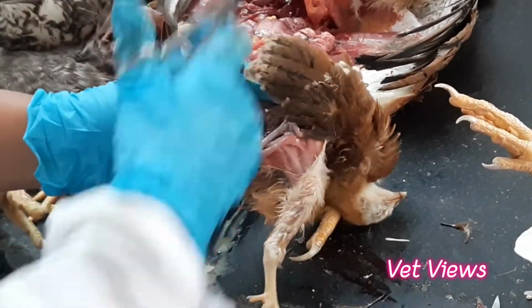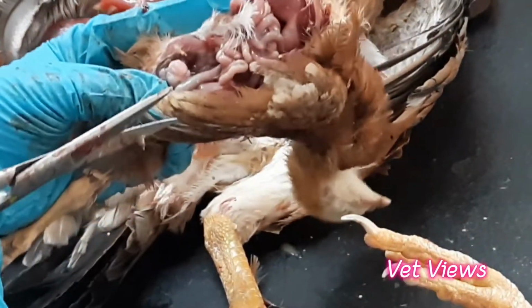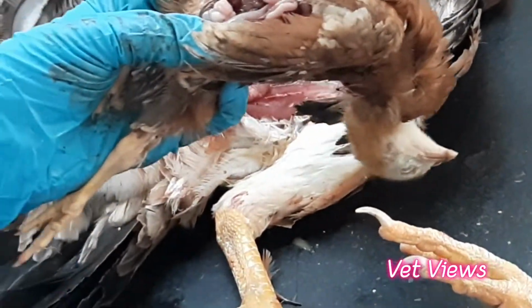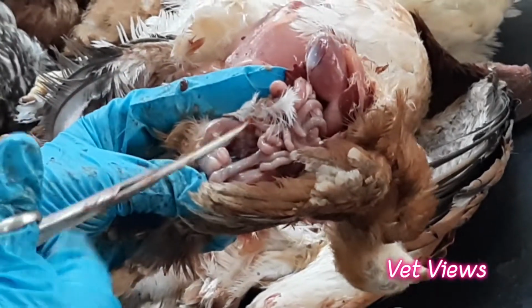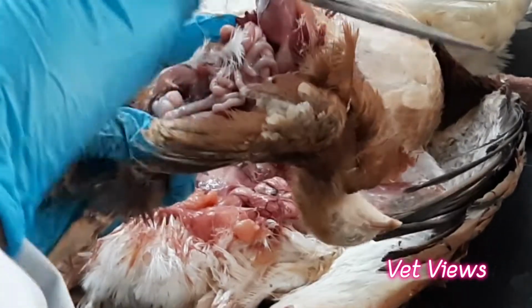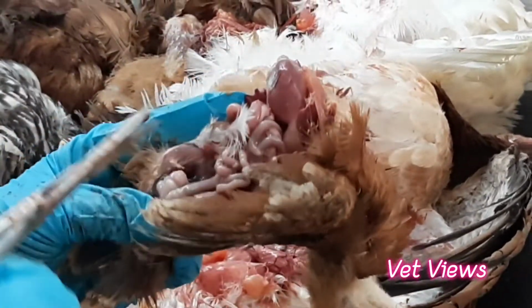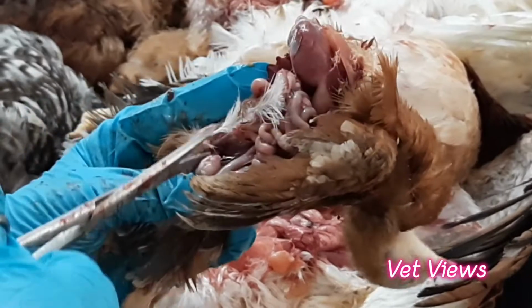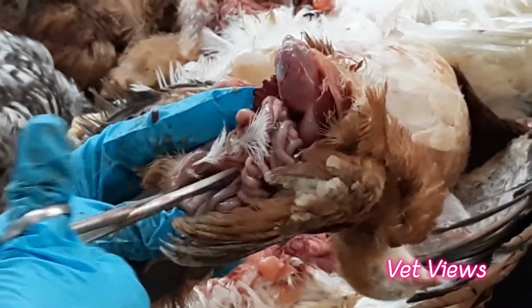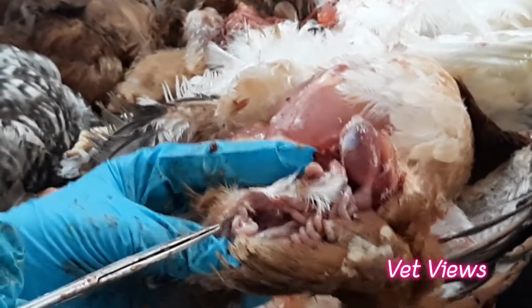See, this is the bursa. Now if you see, this is the bursa and the color is normal and size is also normal. This is the maximum size of the bursa for this bird. When there is infectious bursal disease, when you open it, it will become like a ball kind of thing, so you can easily find it out. There will be severe hemorrhages, and it becomes swollen also. When you cut open, generally it has a lotus petal kind of appearance. See, the petals are coming out. This is normal. There is no hemorrhage, nothing.